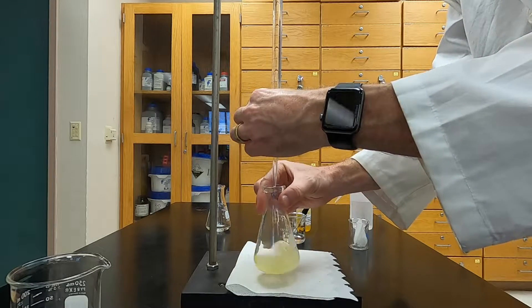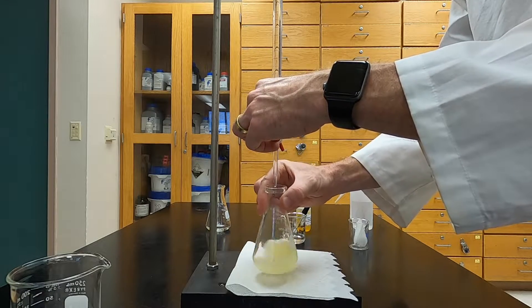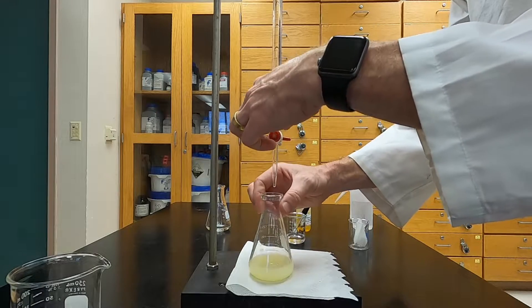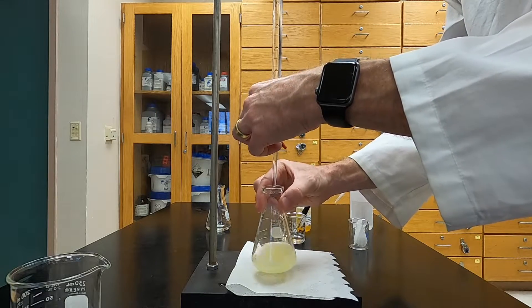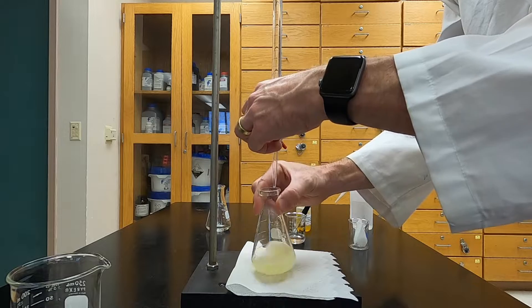Occasionally, you'll want to rinse down the sides of the flask to make sure that any splattered solution gets back into the total solution so you get a quantitative measurement of how much of your analyte is present.